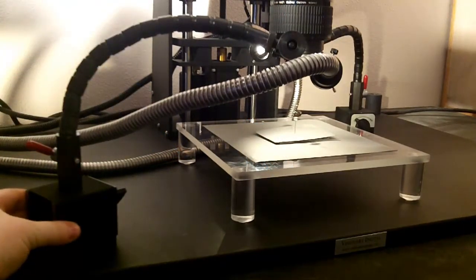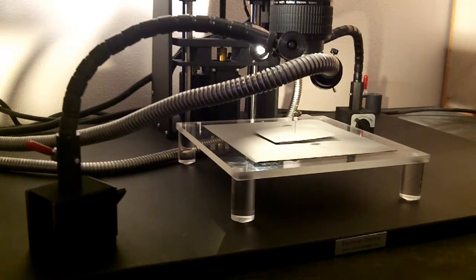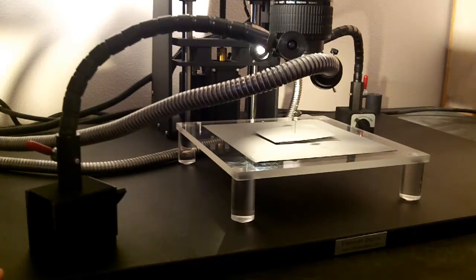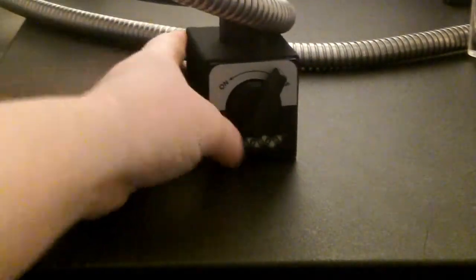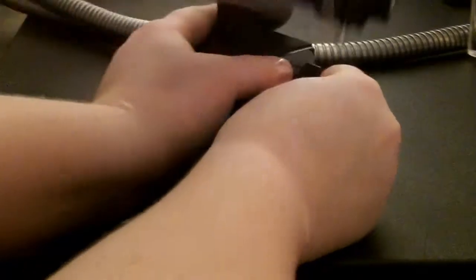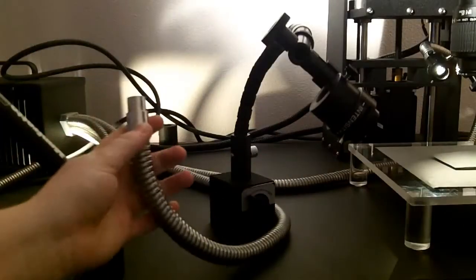The base is held firmly into place onto the magnetic base of the imaging lift. You can see there's an on-off switch. When it's off it's movable and when you switch it on it will be firmly attached to the base.